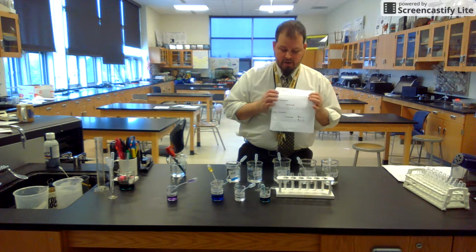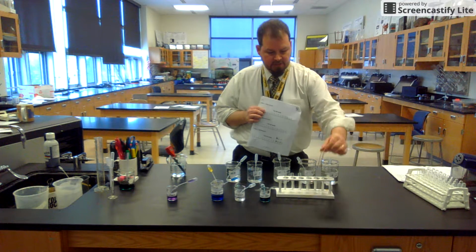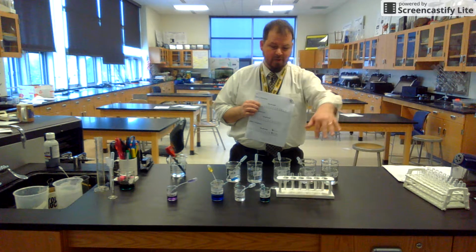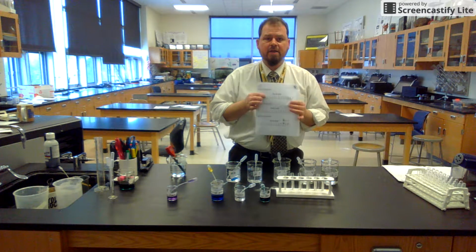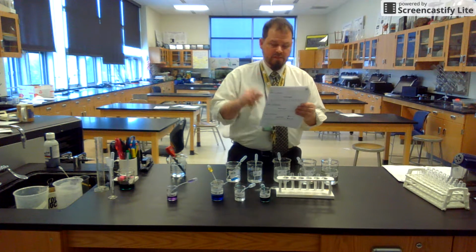So here's where at pH 2, I want to record what color the test tube for pH 2 is. I don't want to show you ahead of time what the color is going to be. I want you to determine that on your own. That's why I didn't really put solutions in here. You have your choice. You can write the color that you see here, or you can color the color that you see here. Good? 2 more tips.